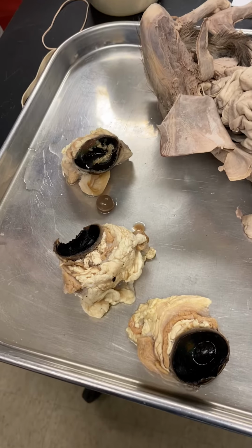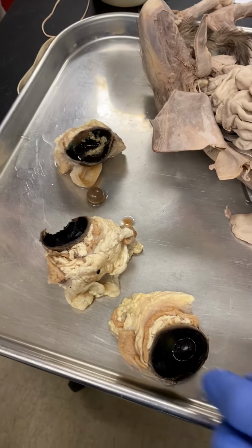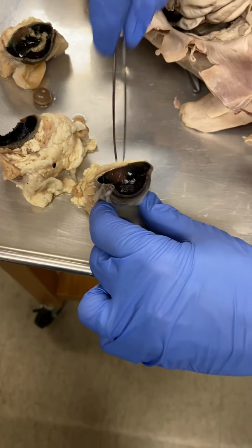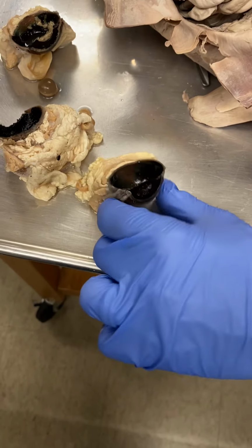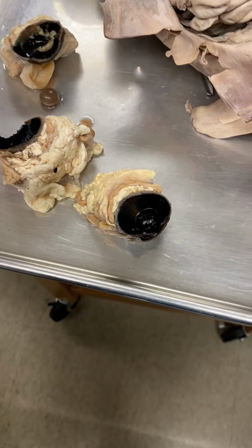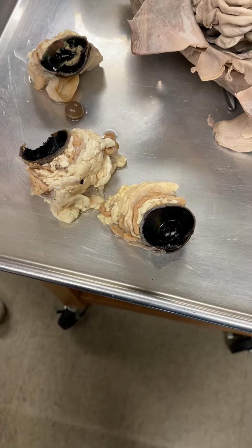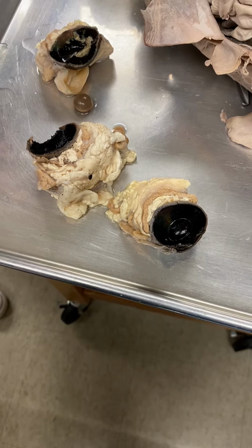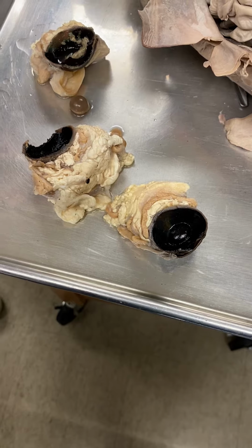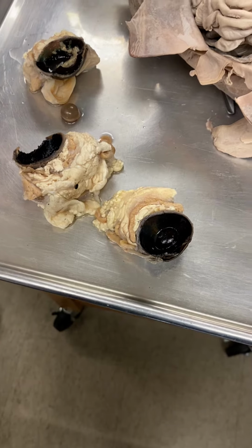In nocturnal animals, you have the tapetum lucidum, which is this iridescent covering here on the retina. It has the blues, the reds, the yellows, and again, that's acting in essence to collect as much available light at night so that they can form an image. And so it's not necessarily night vision, but it helps because that photon is bouncing around, eliciting more of a response. Okay. What else do we need to know here?